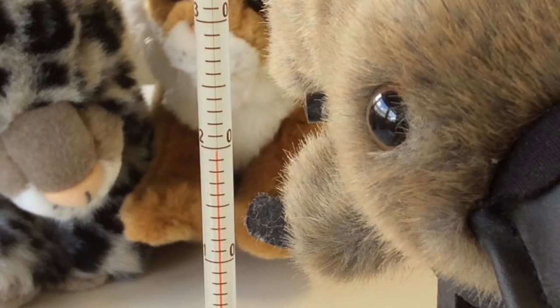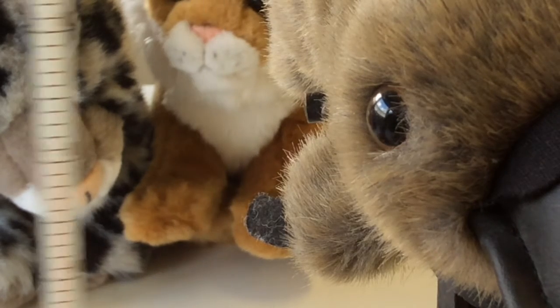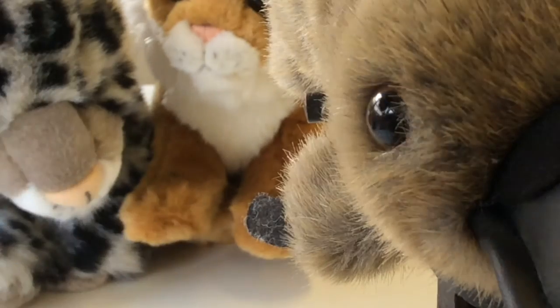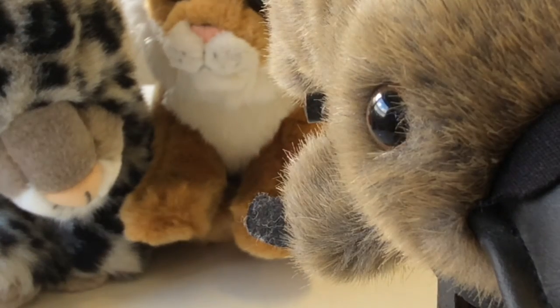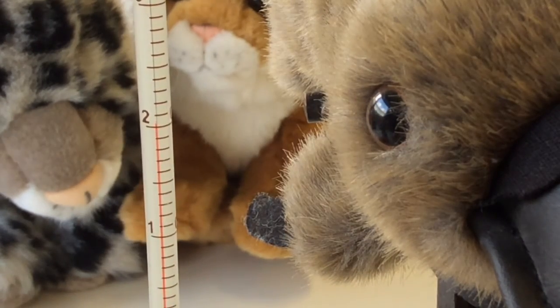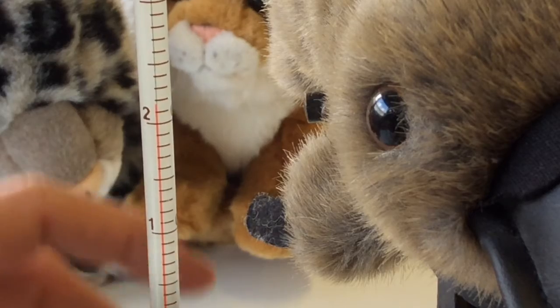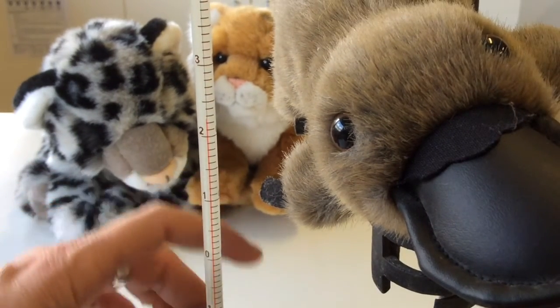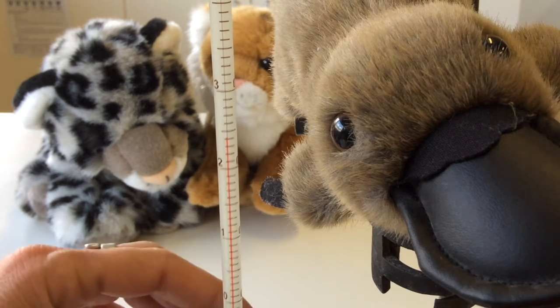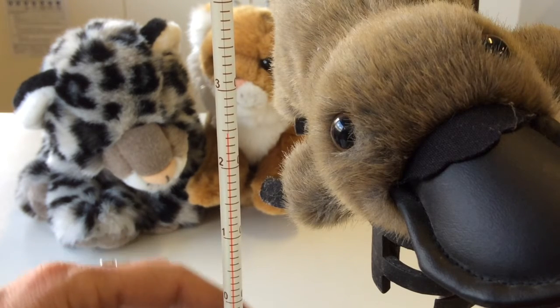Okay, so hopefully you've got those two temperatures down. I'm not recording anything, so you'll need to make sure that you're recording the temperatures. I'm going to add the sodium hydroxide, a strong base, to hydrochloric acid, which is a strong acid. 50 ml of each. I can already smell some gas being produced. What do you think the gas might be? Here we go. Remember, looking for the highest temperature reached.